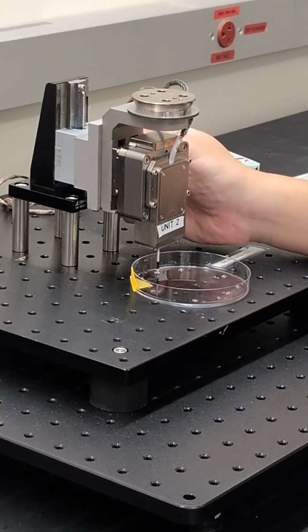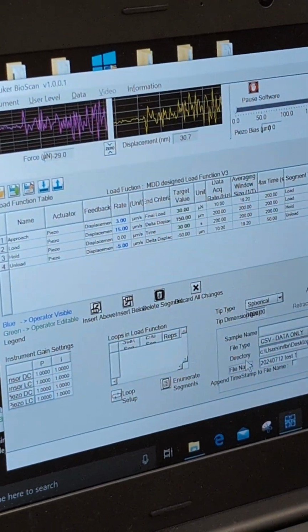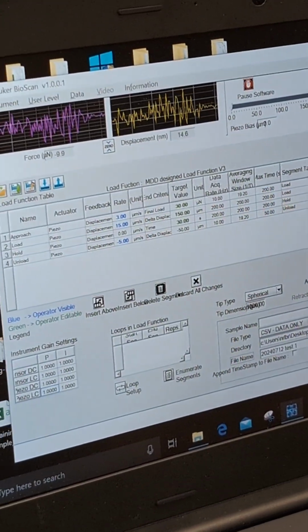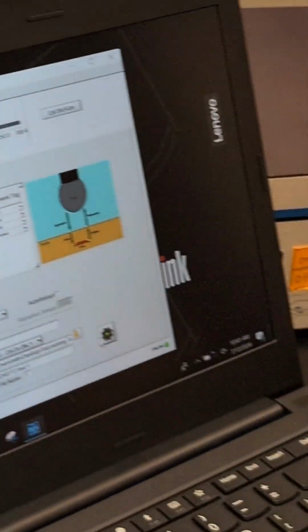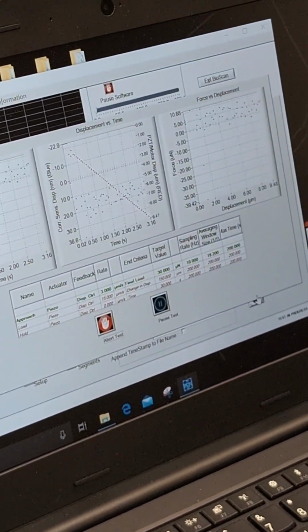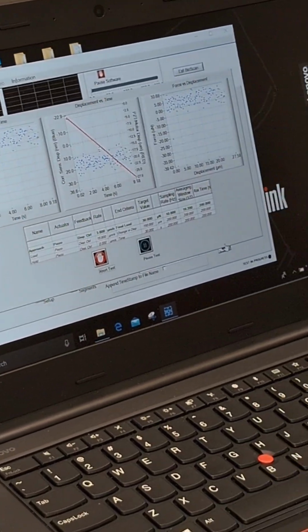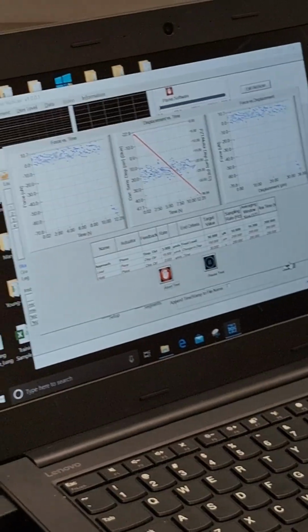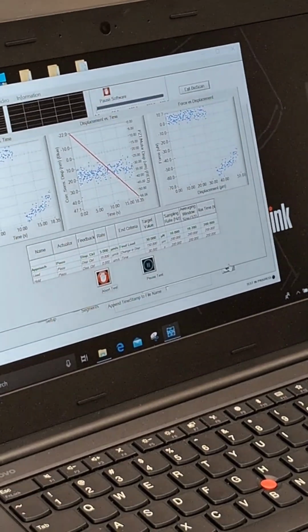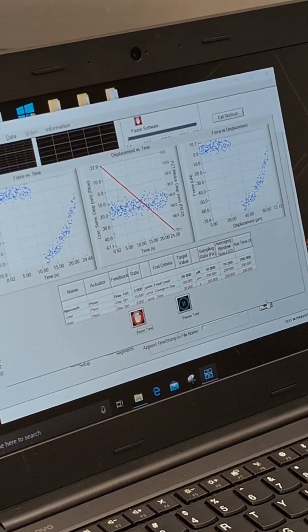It's showing negative force. Let's try this again. So I don't think I should find the gel location this time. I think it's much easier to work with a 96 well plate because once you get in contact, you can clearly tell. This is a bit more tricky. So this will be the equivalent of an incorrect indentation.